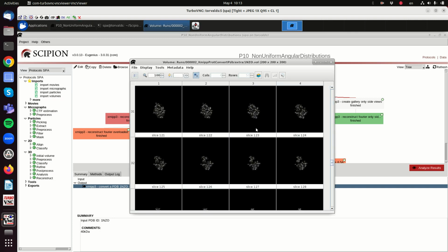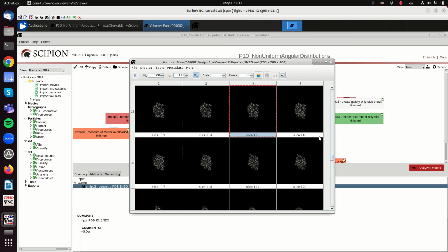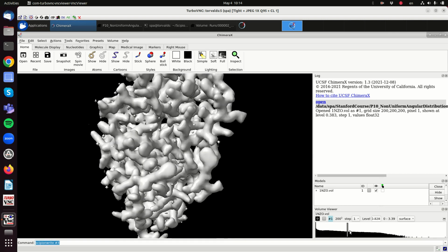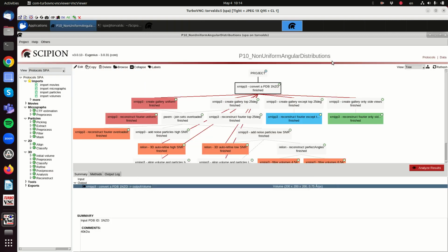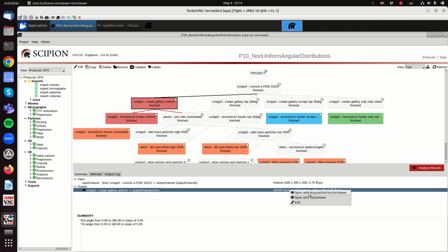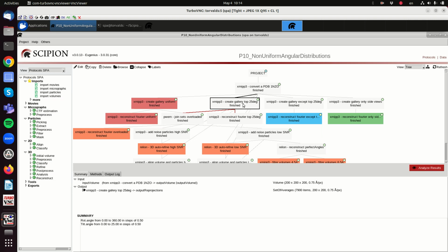So we start with this protein, and then we can see how the map looks like. This is the normal appearance of a converted atomic model, where we see each one of the atoms. We can see the structure in 3D. So this is how it should look like. Now what we will do is generate different galleries of projections. One is uniformly distributed in the sphere. If we look at the angular distribution, we see that it is pretty uniform, while these other three will be biased in some direction.